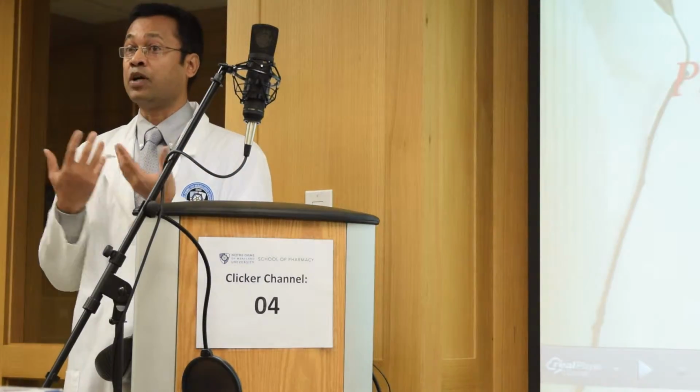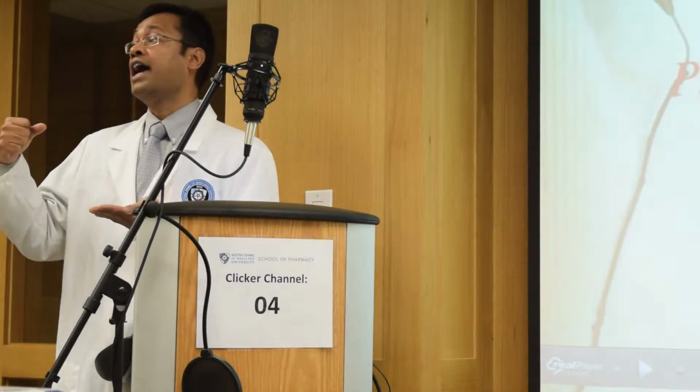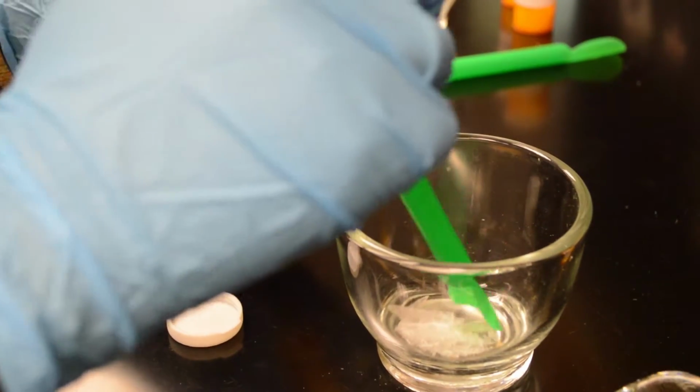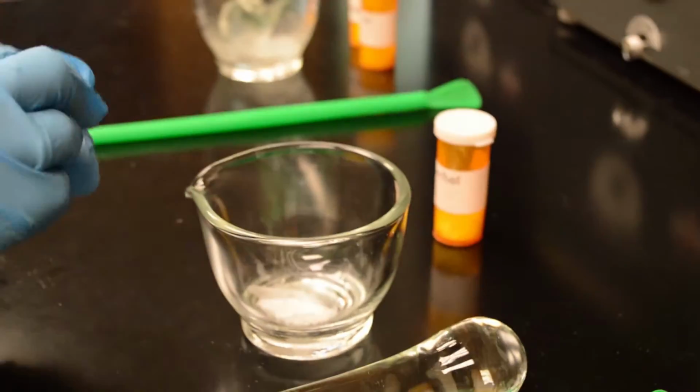In our lab today, you guys take approximately 0.5 grams of each of the ingredients, camphor and menthol, in the mortar using your green spatula, and we'll do a simple process called trituration, which is essentially circular motion of your pestle, pressing both ingredients down and mixing them. So go ahead and take approximately 0.5 grams of camphor and menthol and do the process of trituration, and we're going to see what the final product looks like.